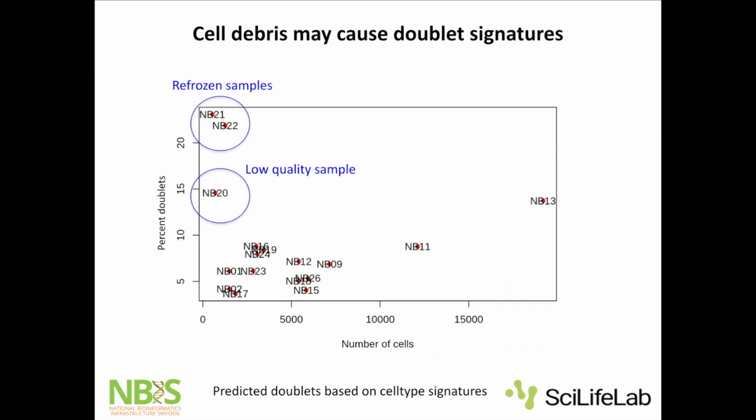This is one project that I worked on where I did my own doublet prediction. And I saw these samples here that looked like we have a lot of doublets. Then I talked to the group and they said, oh yeah, for these two samples, the 10x machine was not working. So we put them in the freezer again and came back next week. So these samples went through 2 freeze cycles. And I think probably we just have cells sticking together, cell debris and stuff that looks like a doublet signal. And then also this sample was just lower quality. So these numbers that 10x gives you on how many cells you load and how many doublets you end up with are for an ideal experiment, but it might look like you have much more than that in your real data.